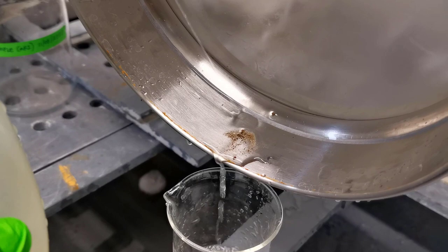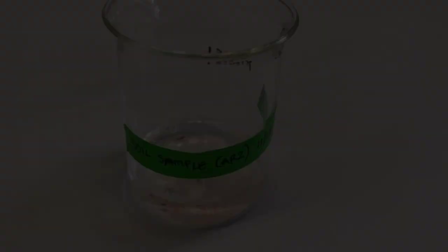Using a water bottle, wash out the nematodes to a concentrated suspension in a smaller beaker. This is the final concentrated nematode suspension ready to be used for further analysis.